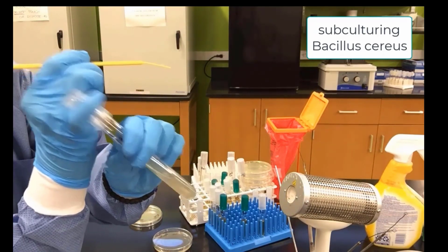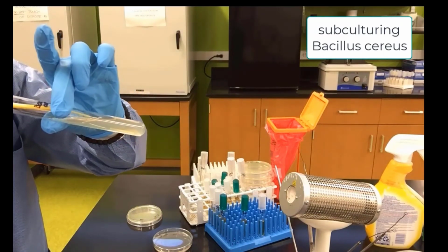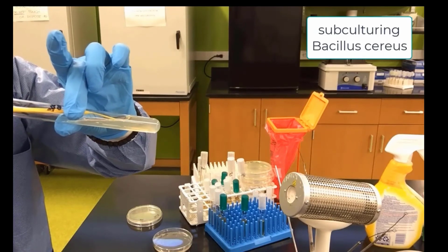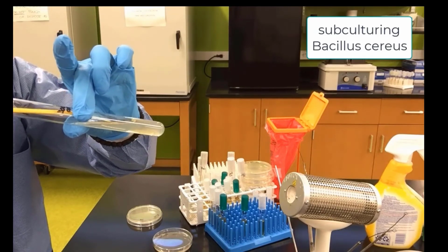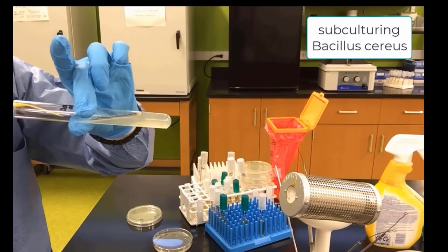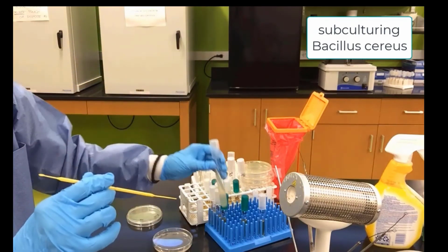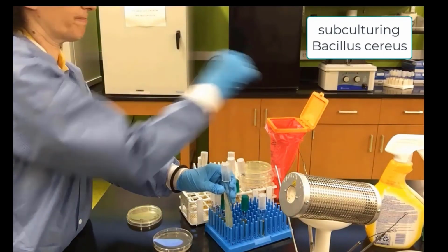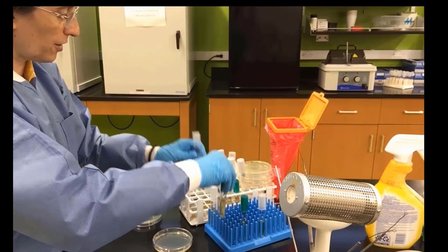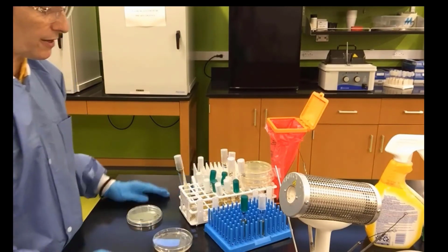We open the agar slant. We go in and we zigzag on the surface of the agar slant. It's a little difficult here, you can see, because it's bent. If this happens, usually you can fix it before you take it out of the bag. And we throw away our loop. So we have completed now Bacillus cereus subculturing. We'll organize everything onto another rack.